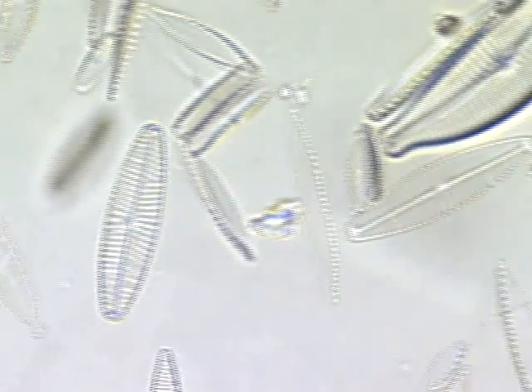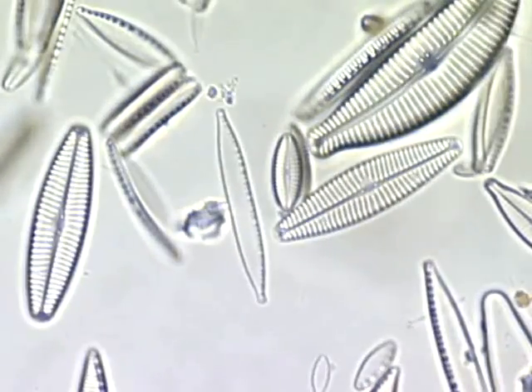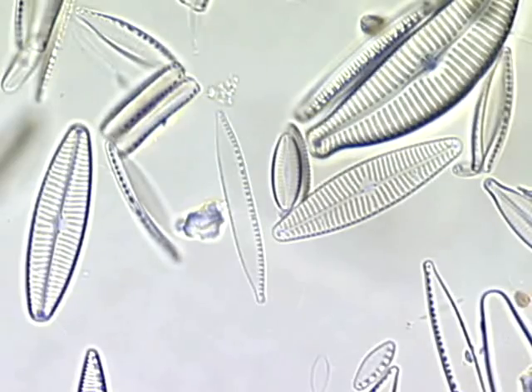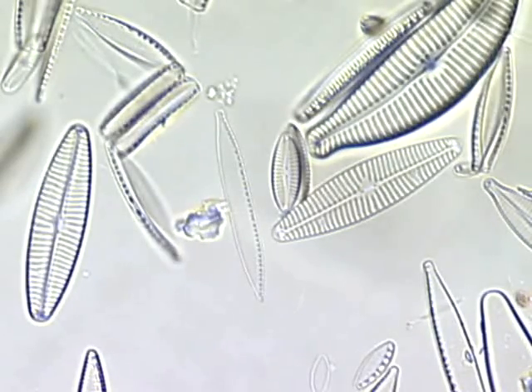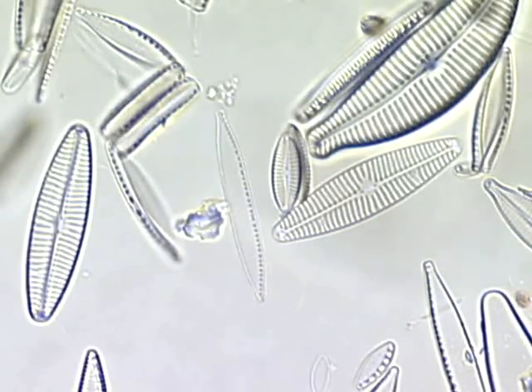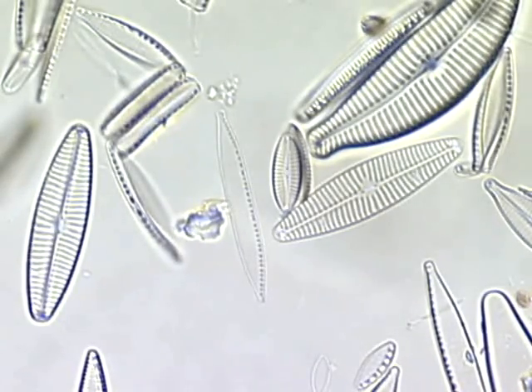These diatoms were collected from a slightly polluted river. What kind of diatoms would you see from a cleaner river or from a more polluted river?